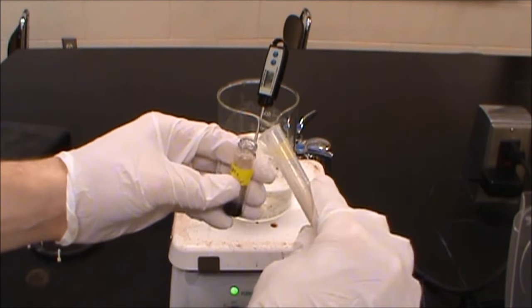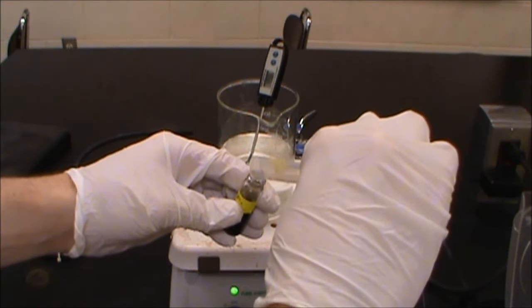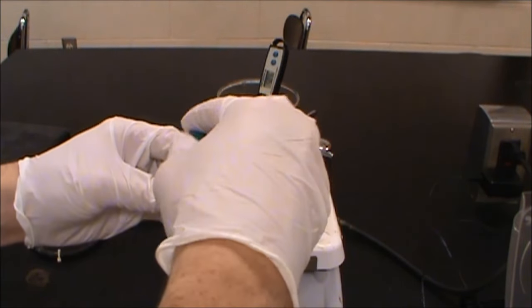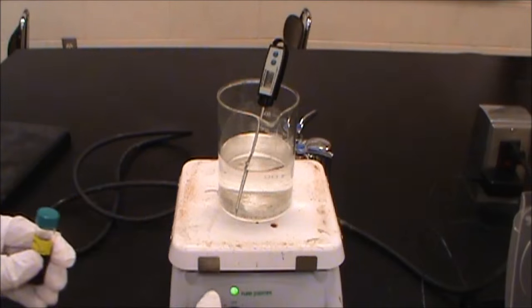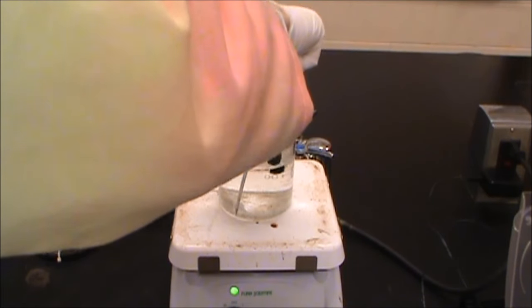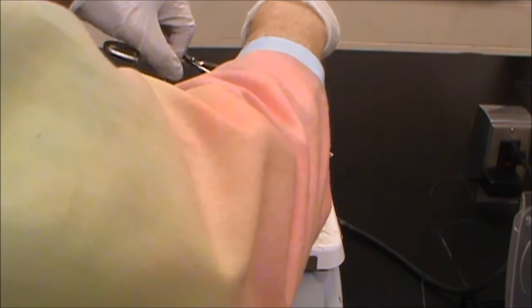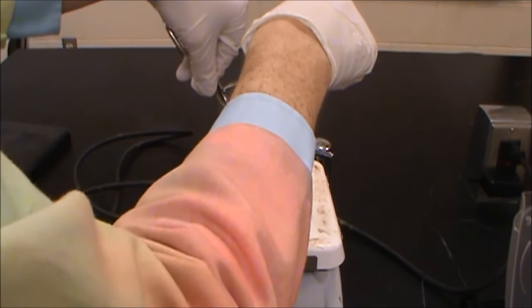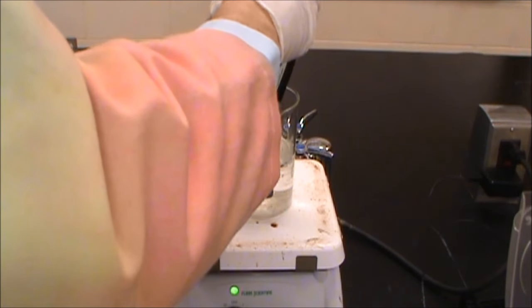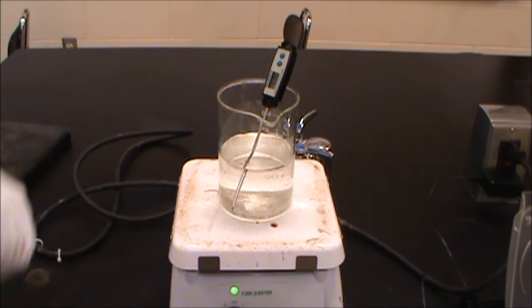So what we're going to do here is we're going to take this 0.07 grams of indigo dye. We're going to add to it 5 milliliters of sodium hydroxide. We're going to seal that up really nicely. And we're going to set this in our 50 degree bath that we have going here. So we want to keep this at 50 degrees. We do not want to see it boil. So I'm going to take some tongs here. Gently set that in there. So we want to set that in there for about 5 minutes and we can see that it's already bubbling. So I need to get that. Take that out. We're going to try that again.